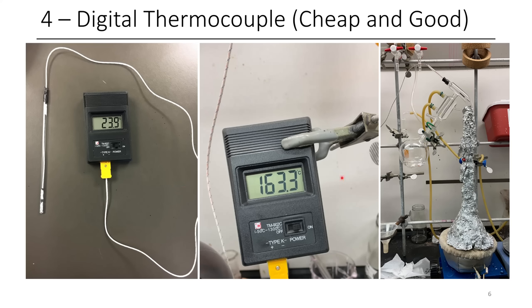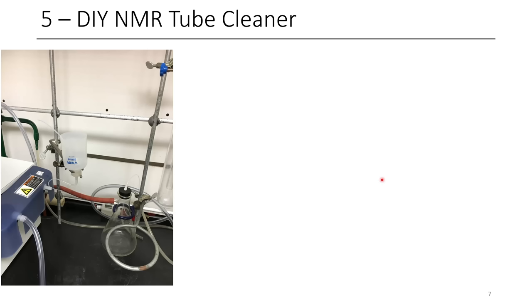If you haven't tried them, I definitely recommend using these. If you ever have to do distillations, it's just way better. Even if it's off by a couple degrees, the responsiveness is just much better than you get in a typical alcohol thermometer. OK, so the next and final one is the DIY NMR tube cleaner.